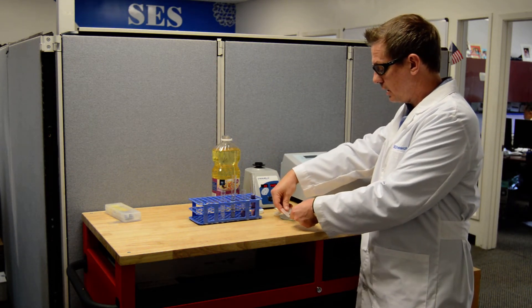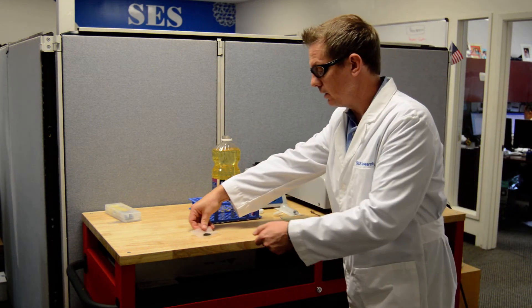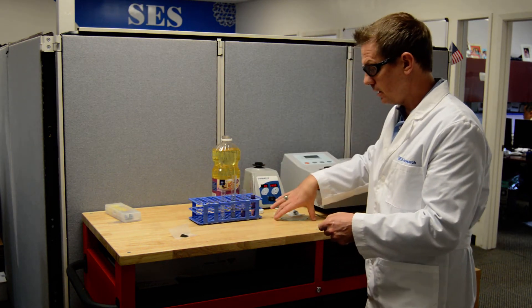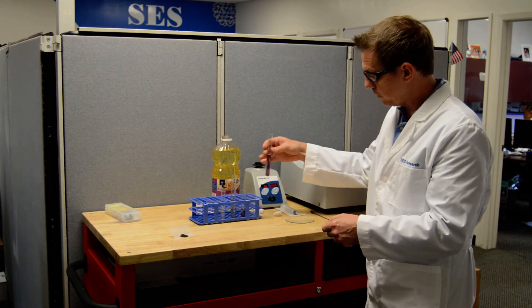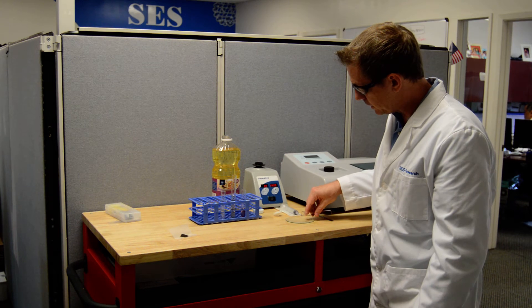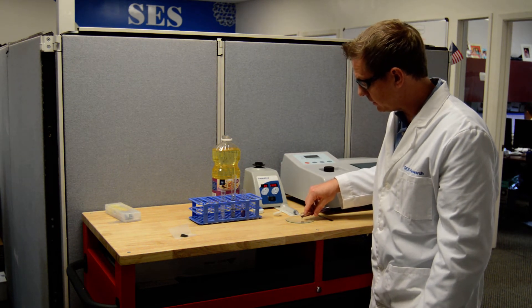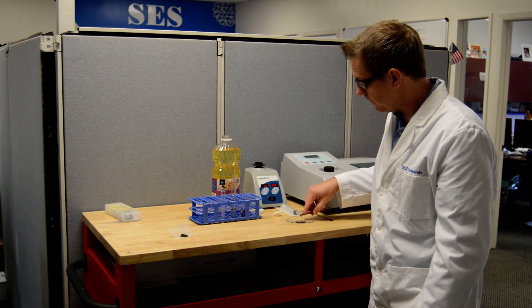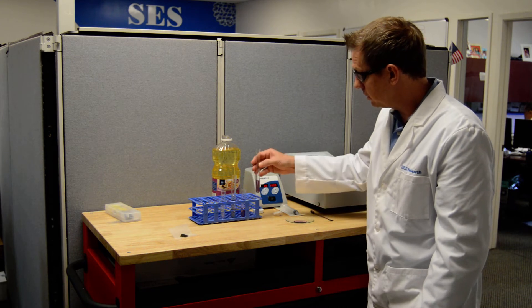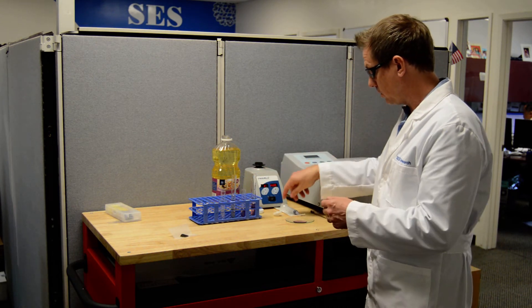I'm going to move this C-60 kind of out of the way over here and then I'm going to just pour this purple solution. This is actually mixed for about seven to ten days so actually more C-60 could go into solution.